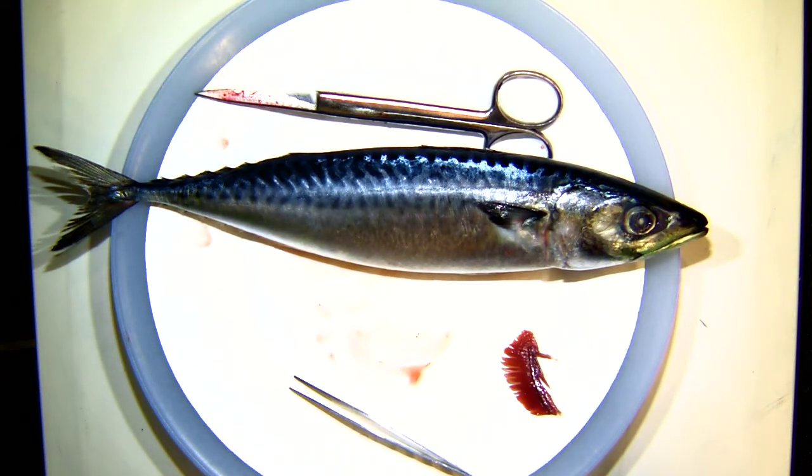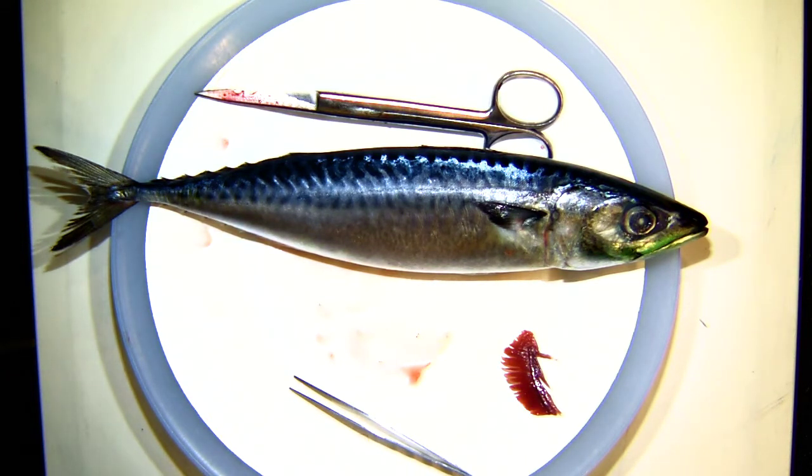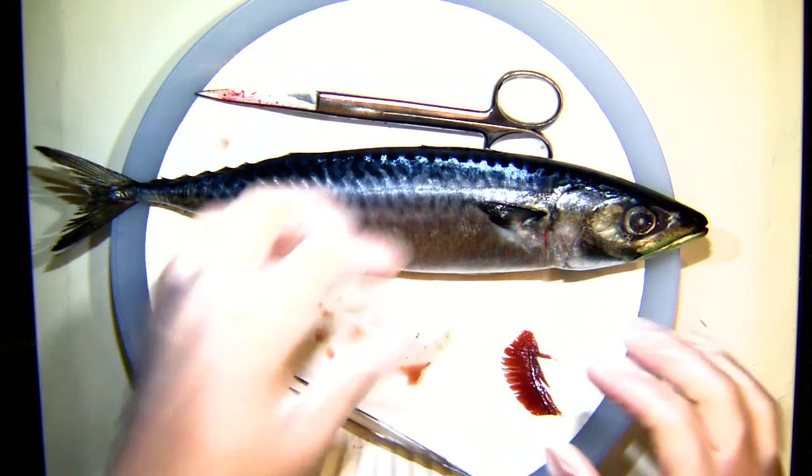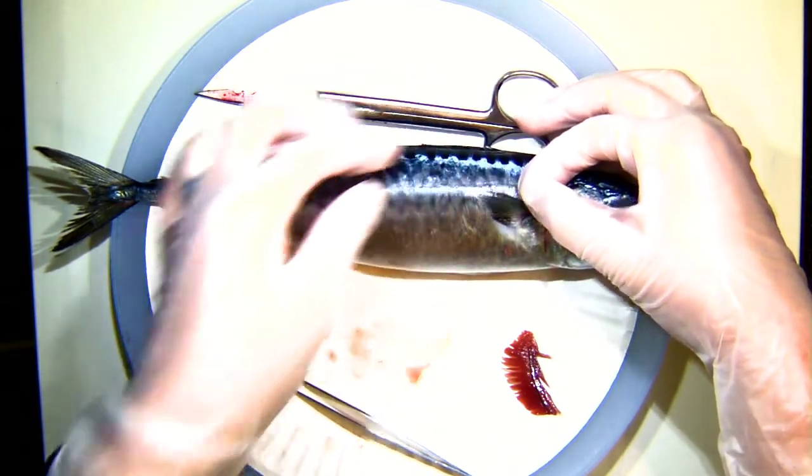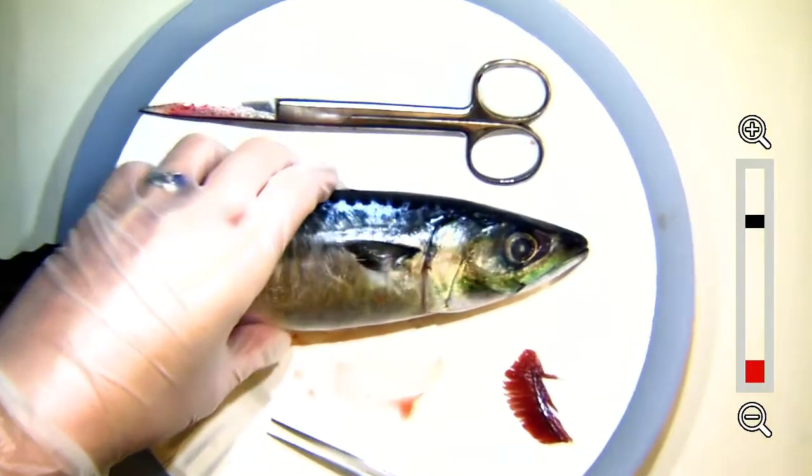One thing I often hear is that fins make a fish. It's true that most fish do have fins like this. This one is called a ray-finned fish, because if you take a close look at these fins you can see all those lines — those lines are almost like little bones, and that's what gives these fins rays. There's that structure to the fins. They have different fins used for different things. The fin I zoomed up on here is called a pectoral fin, because it's connected to pectoral muscles.